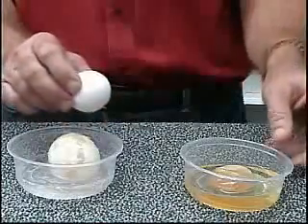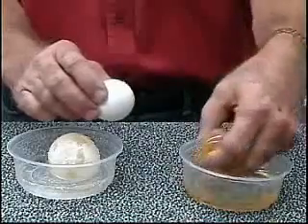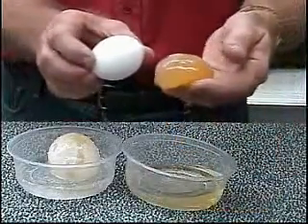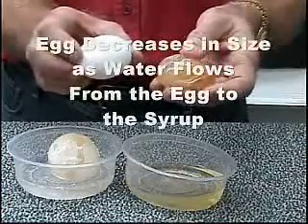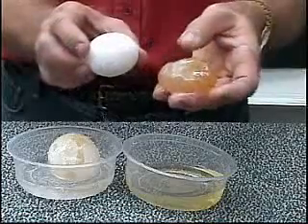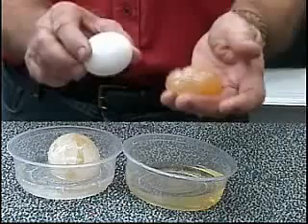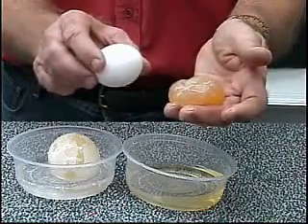In our second instance, we have an egg that was in a syrup solution. A little messy here. But you'll notice that this cell has lost a lot of its liquid. If it weren't for that large mass of yolk in the egg, this would be even smaller than you see here. So this egg was in a hypertonic solution, and water was drawn out into that very concentrated sugar solution.